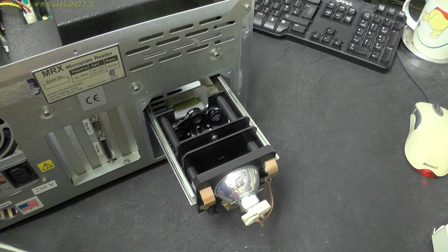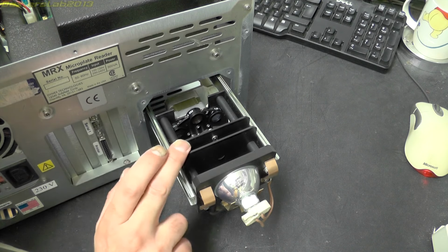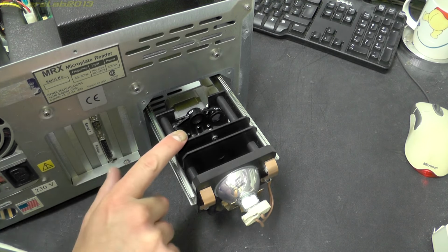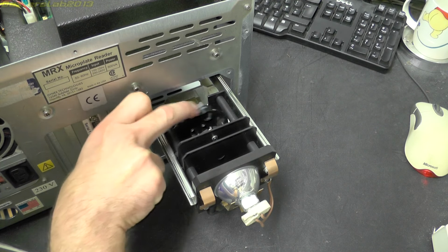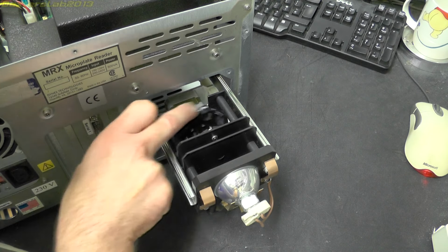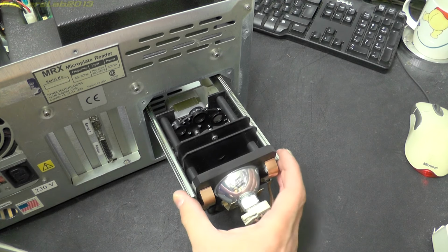So we have what is quite clearly the light source going through a couple of lenses, or is that just one lens? I think there's just a mask and then a lens, and then we have a wheel full of different filters. That appears to be attached to a stepper motor. So we've got a really nice sliding mechanism here.